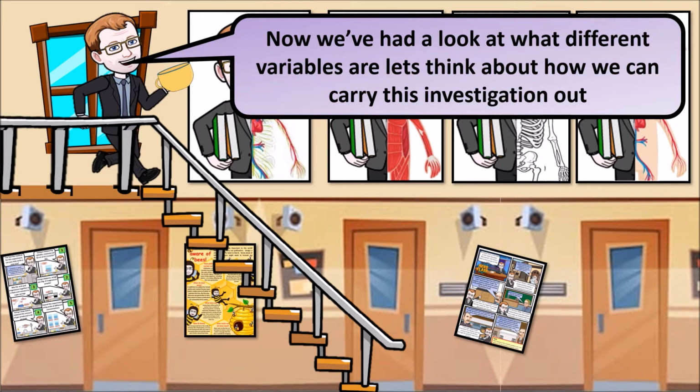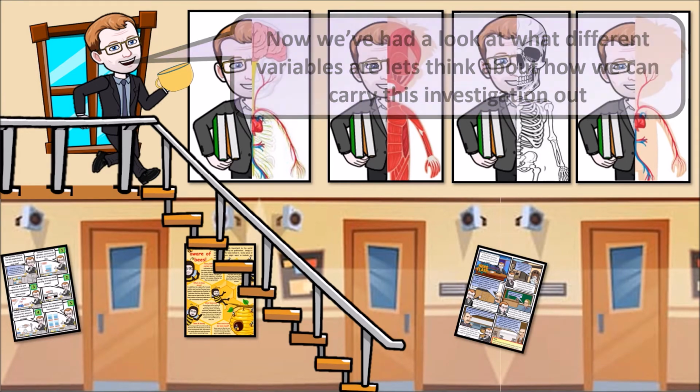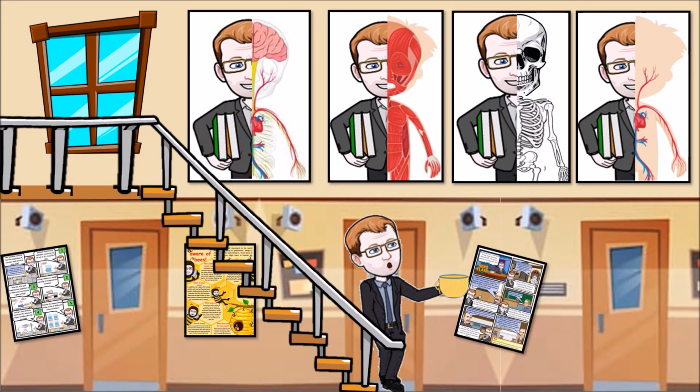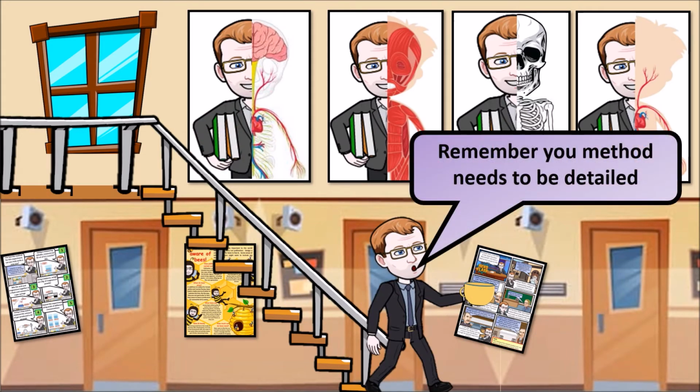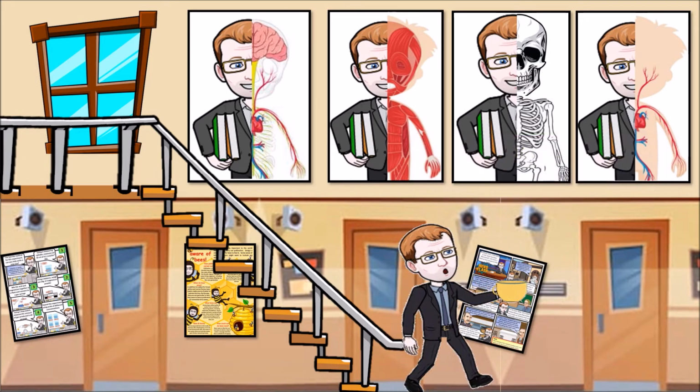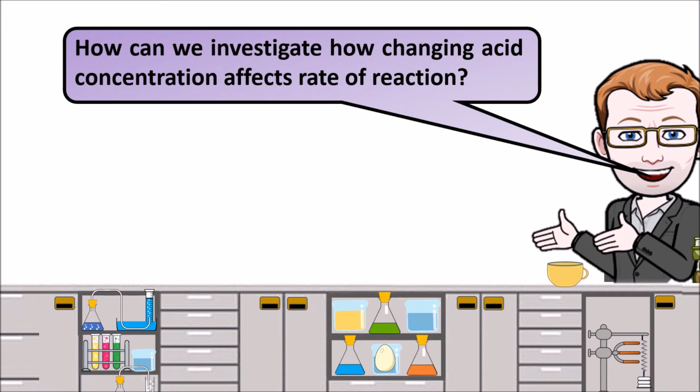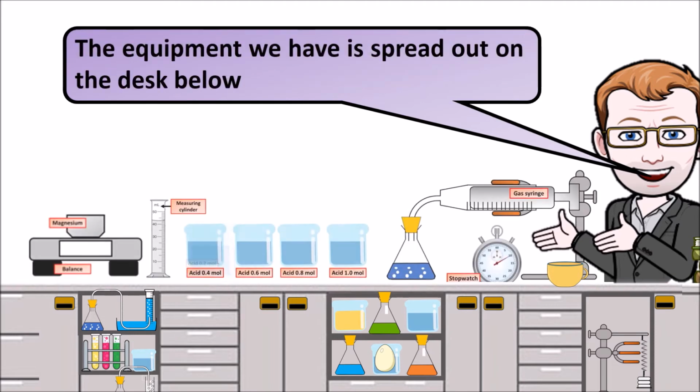Now that we've had a look at different variables and things, we can go and look at how we carry out the investigation. So remember, when you're putting a method together, it needs to be detailed. So we're going to look at how changing the concentration affects the rate of reaction. Some of the equipment that we're going to use is shown below.